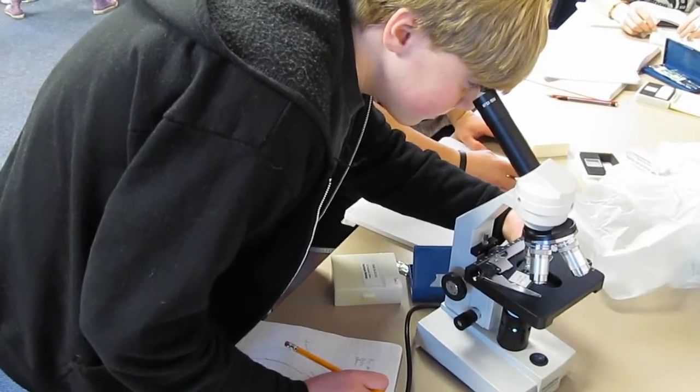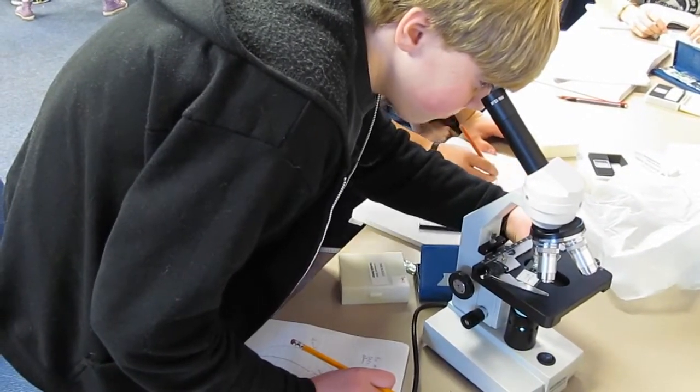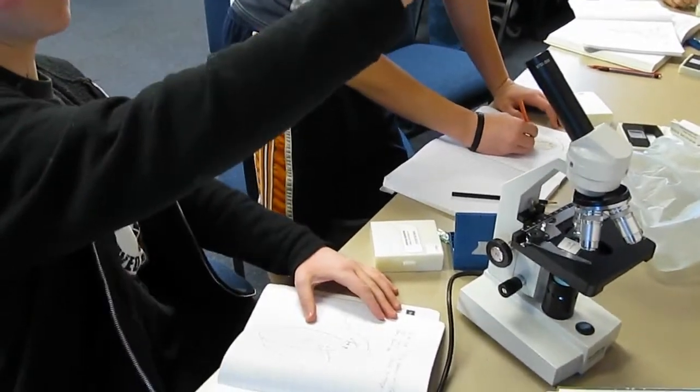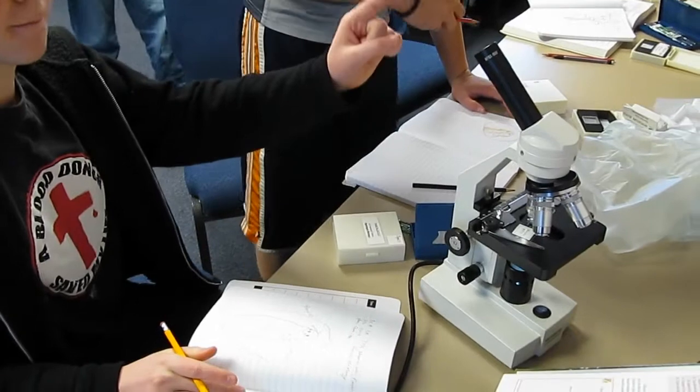Yeah, if you got it cleaned up, because you should be done. So why someone's getting the planaria or the hydra. Is that the nerve, this little here? Can you look? I don't know.